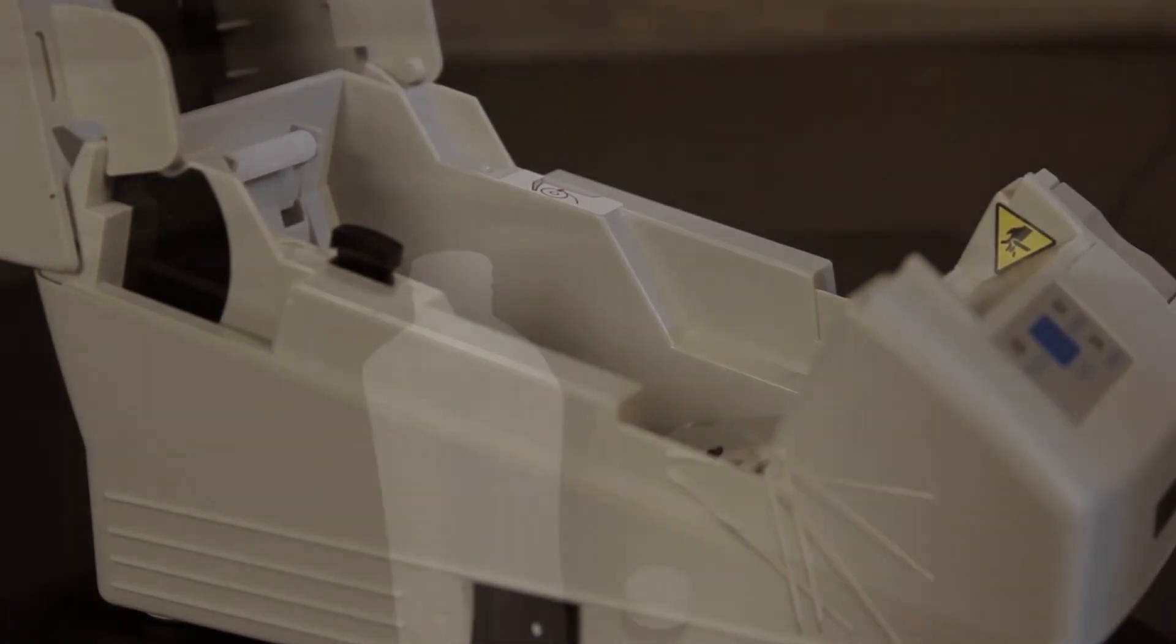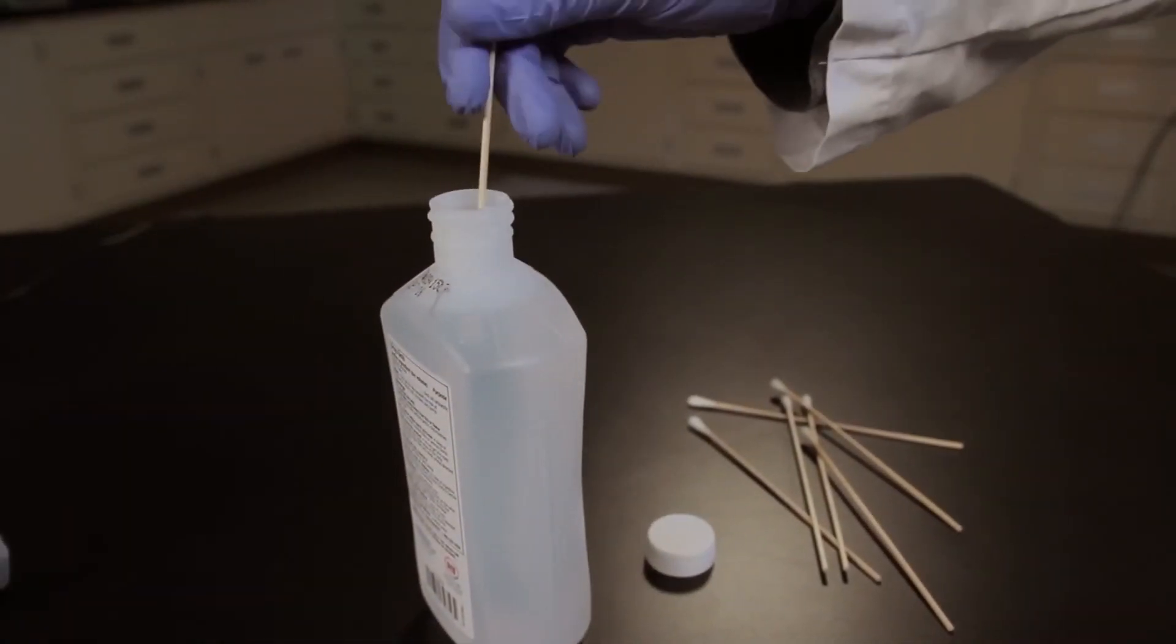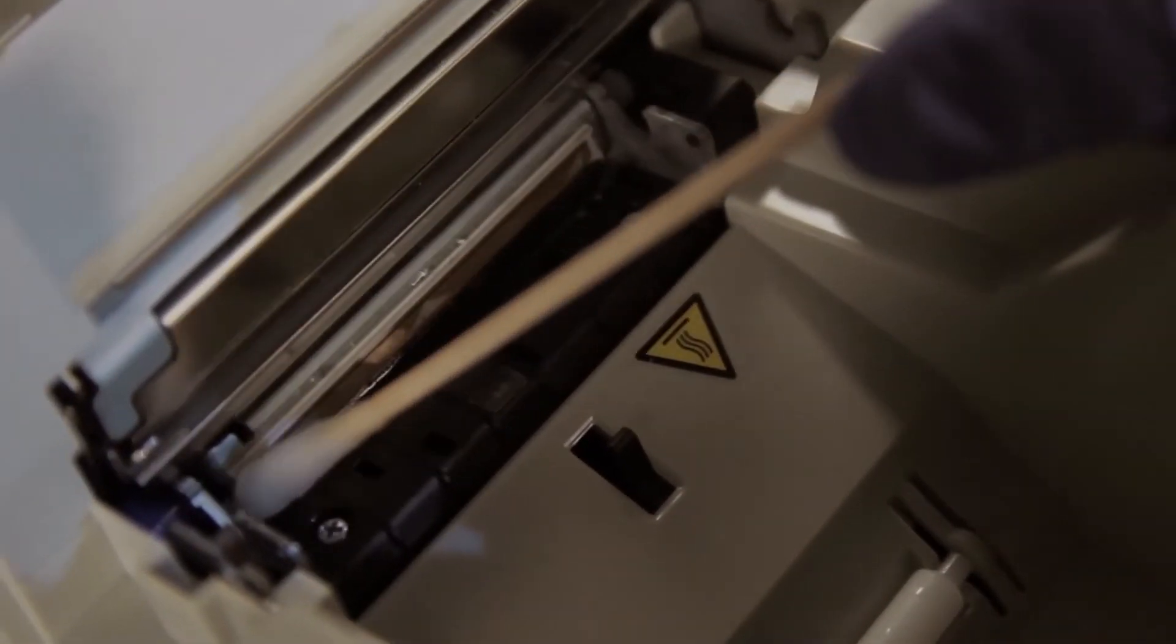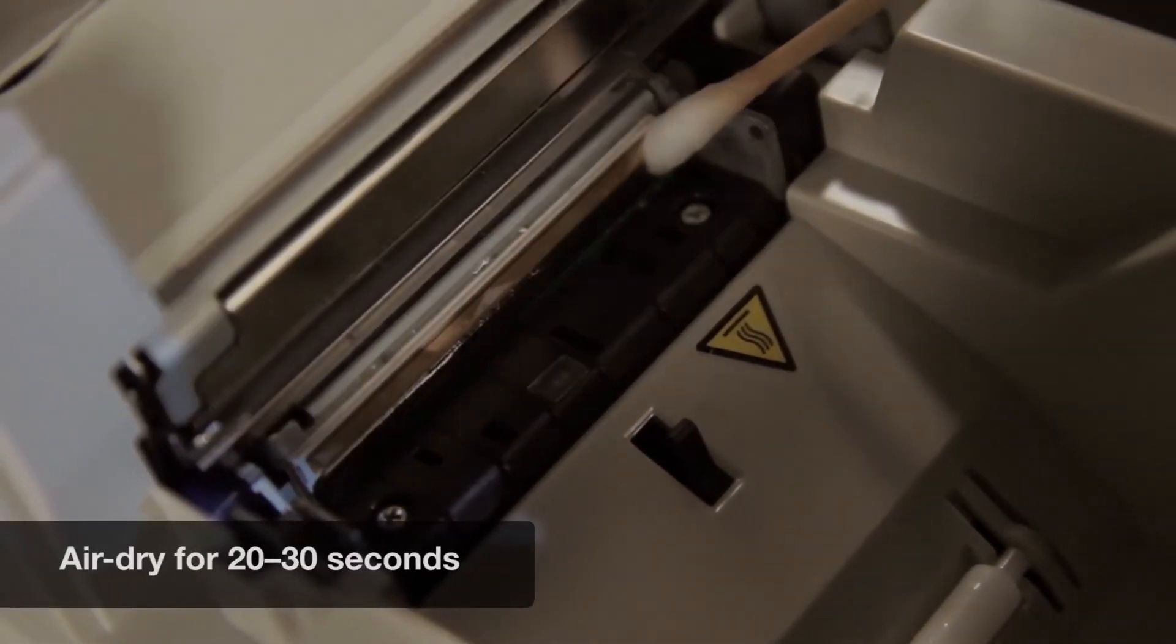Put on gloves, moisten the cotton swab or cloth with the alcohol, and gently swipe the printer head to remove any paper residue that may have built up over time.